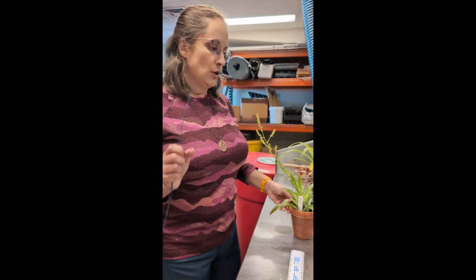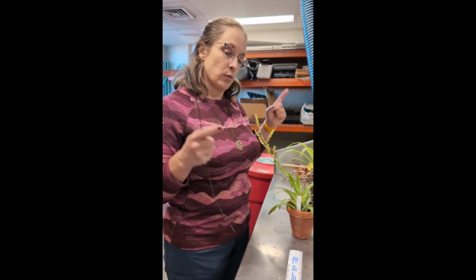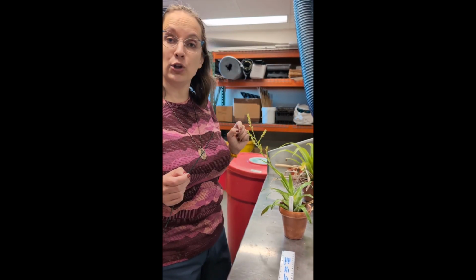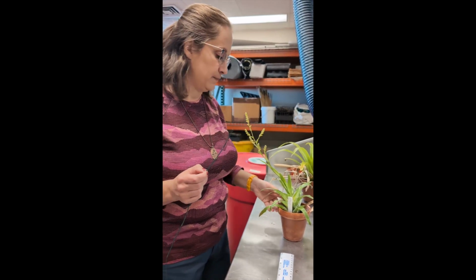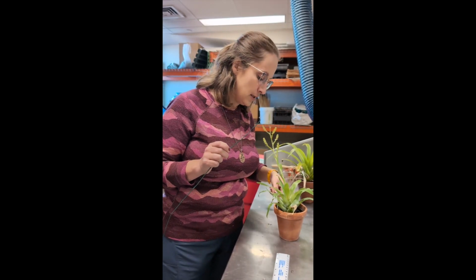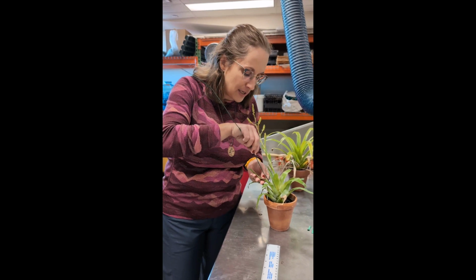Okay, so the first thing we're going to do is, with our eyes, try to identify which leaf we suspect is the longest leaf length. I'm pretty good at this. I often can get it at first pass. Okay, I think we've got a real contender here.